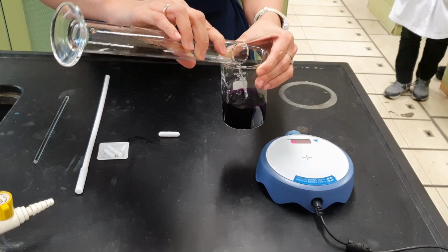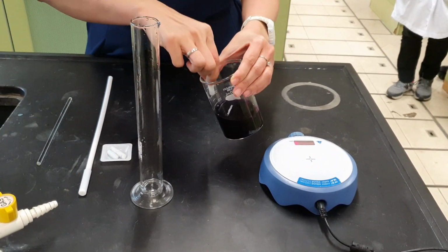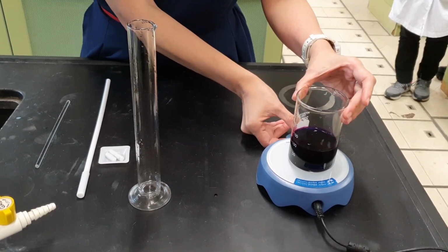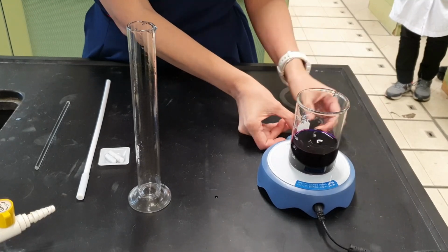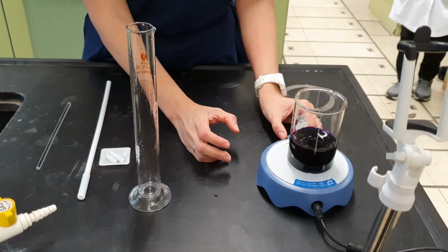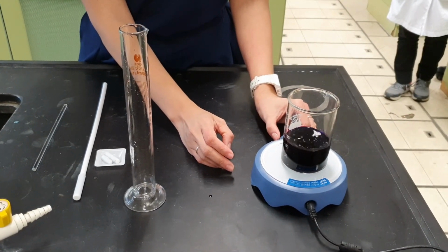Next, pour a small volume of distilled water. For example, if you are preparing a 250 ml solution, you may want to add a portion of the total, about 100 ml of water first. Insert a magnetic stirrer bar, you may get one from the laboratory technician. Place the sample on a magnetic stirrer and let it mix for a while.